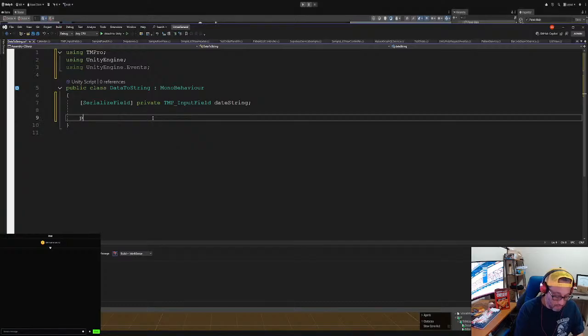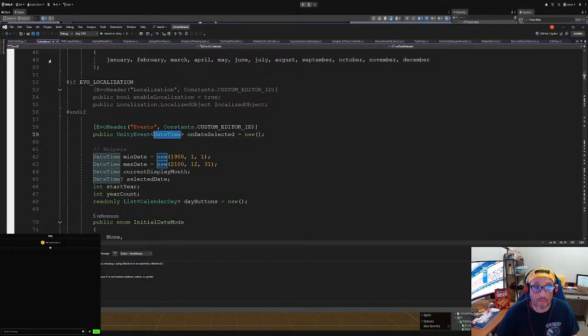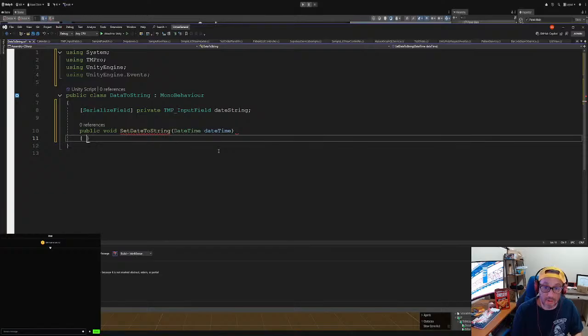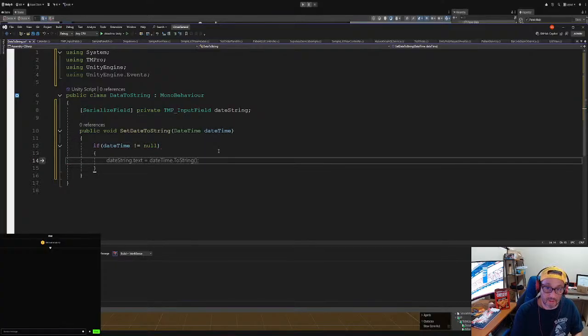So, void date string, and then we are going to say date time. Is it date and time? Oh no, date time, date time, right? And then we are going to say date time is not equal to null. Then we are going to say date string equals there. There we go. All right, that's a very simple script, and we're just going to attach it to here.